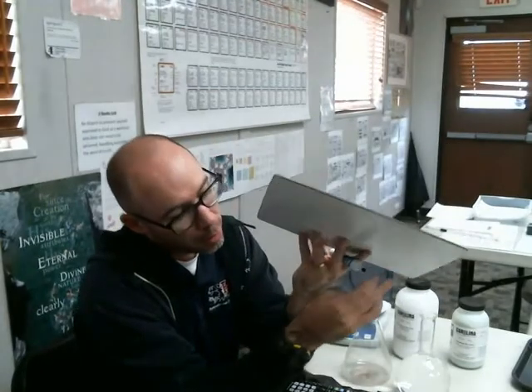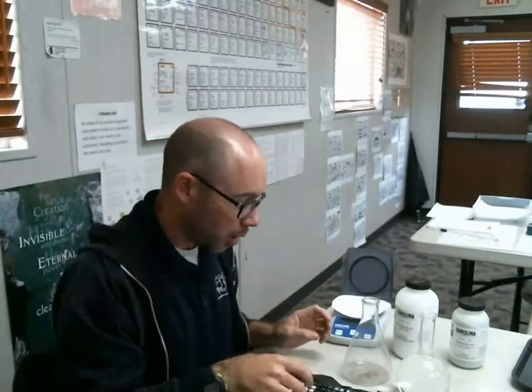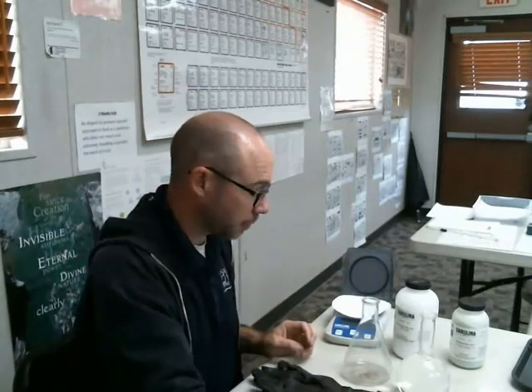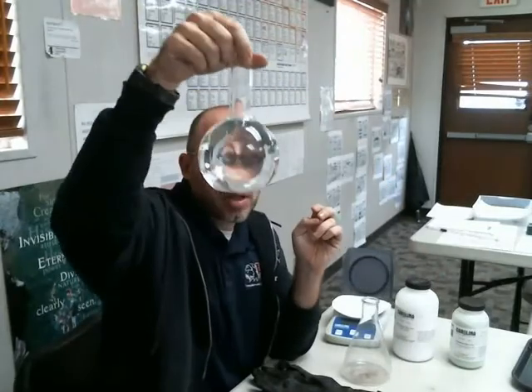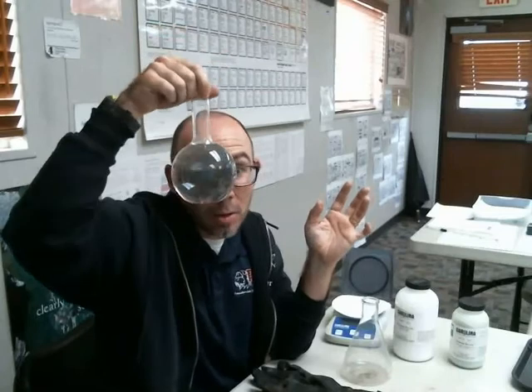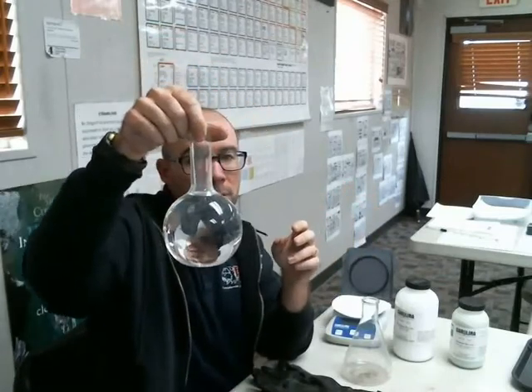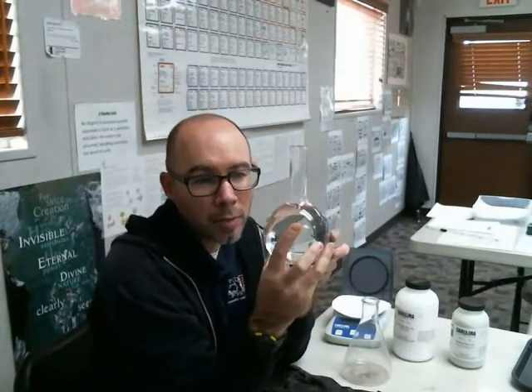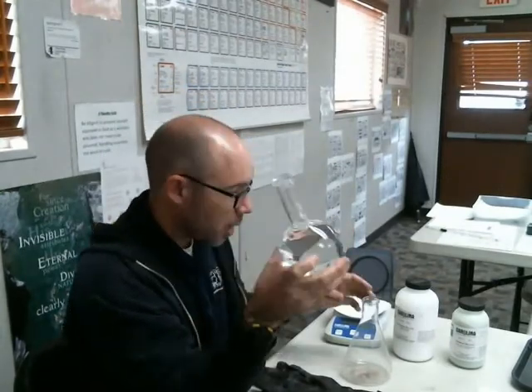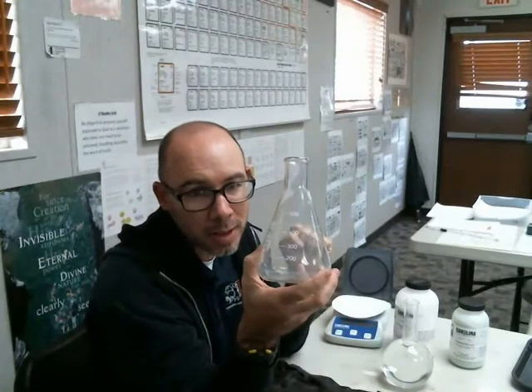Now, to show you the process for going about this, you don't just dump it in a bunch of water and stir it, because you really don't know exactly how much water that you're going to need for the process. I've got here one of these flasks, and I filled it up with exactly, or as really close as possible, 500 milliliters of water, half of a liter of water, okay? And over here, I've got a 500 milliliter flask. And it's got a line there so I can get as close to that line.